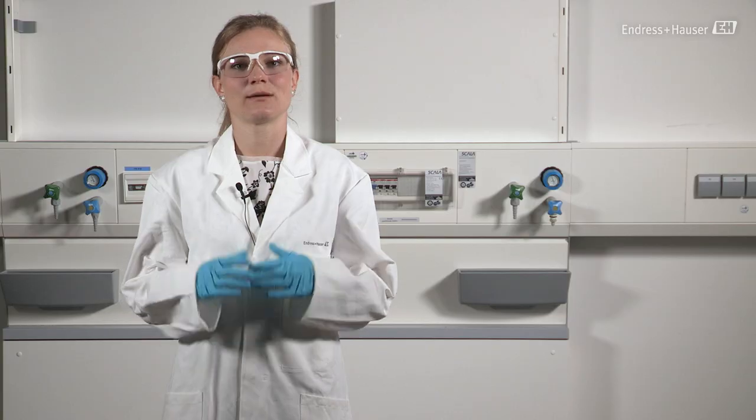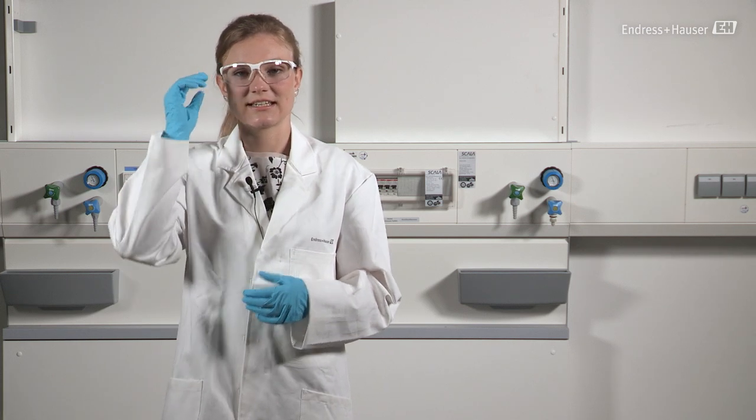I will now show the installation of the sensor in the assembly. Please always remember to put on your personal safety equipment before starting to work: your safety glasses, chemical resistant gloves, and a coat.